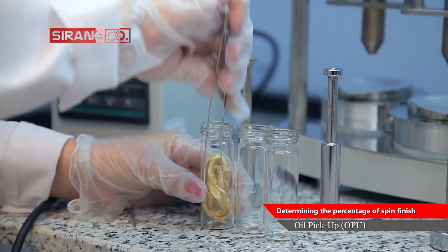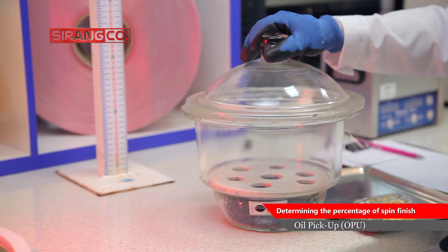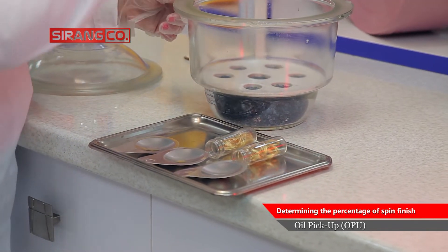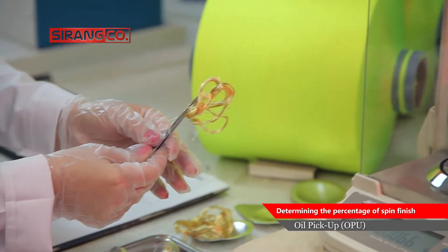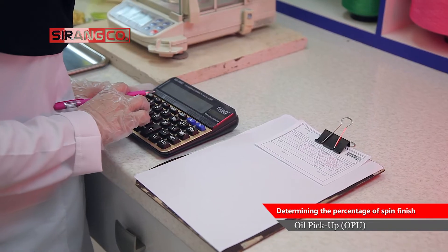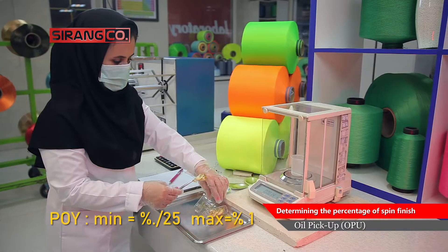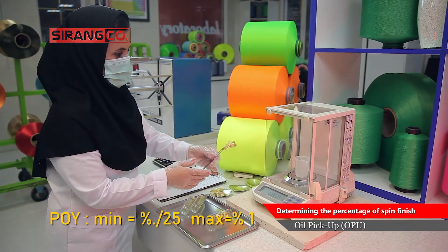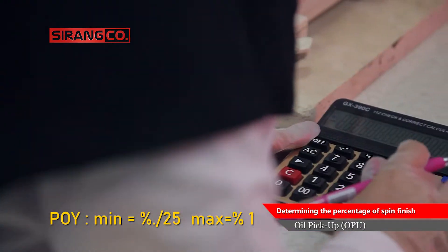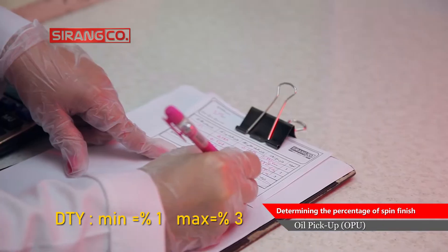The yarn sample is also dried in the oven, and having the weight of oil and dry yarn, the percentage of oil can be calculated. The allowable range for the percentage of POY and DTY yarn oil according to the National Standard of Iran is 0.25 up to 1% and 1 to 3% respectively.